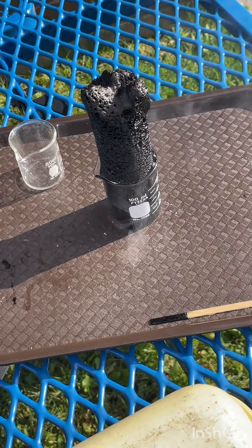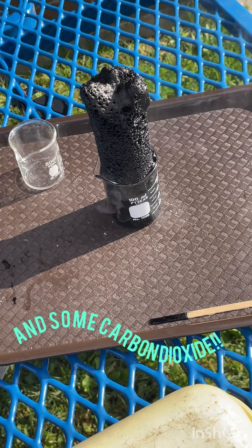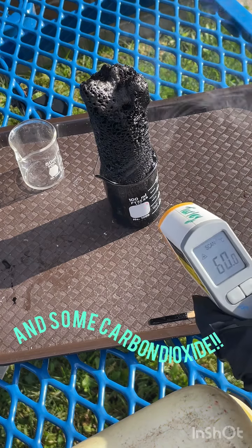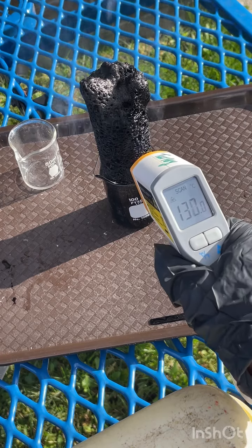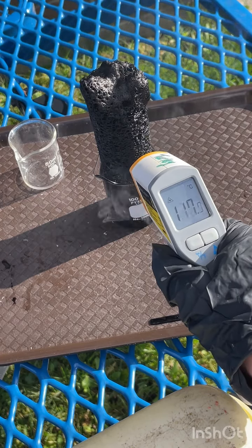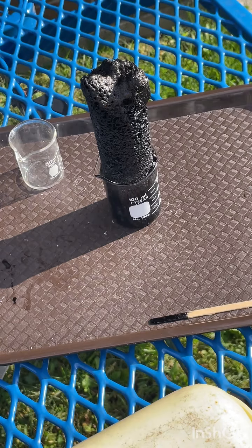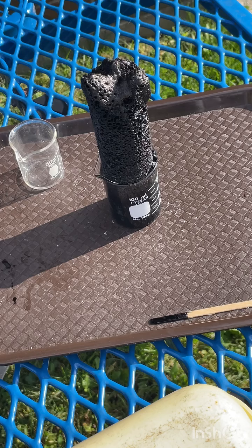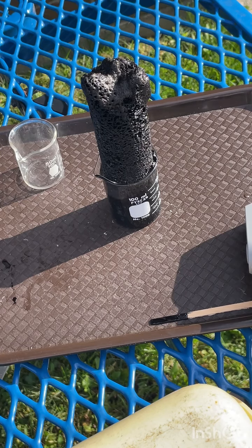We could see steam, and that steam is going to include some of the water as well as the sulfur dioxide. Our temperature now at the bottom of the glass is about 50 degrees. On the column, it's up to about 130, and at the top, it's about 92 degrees, and that's Celsius. So we know that the boiling point of water is 100 degrees Celsius, which means that any water that's formed is very quickly being released as steam because it's well above that boiling point.